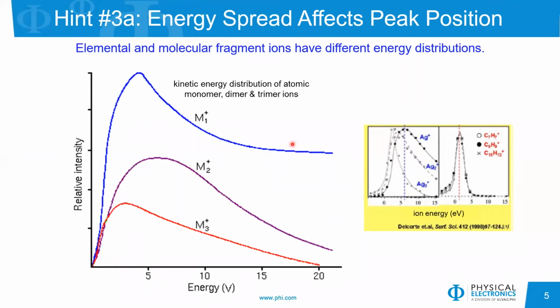Energy spread affects the peak position, and this is particularly critical when you're looking at atomic ions. So if you look at an atomic ion, say at a nominal mass of 27, and you're looking at your copper grid on aluminum tuning sample, and it's very common to look at mass 27, what you'll see is that on the low side of nominal mass, you'll see the aluminum peak. And on the high side of nominal mass, you'll see the C2H3 peak in the positive ion polarity.